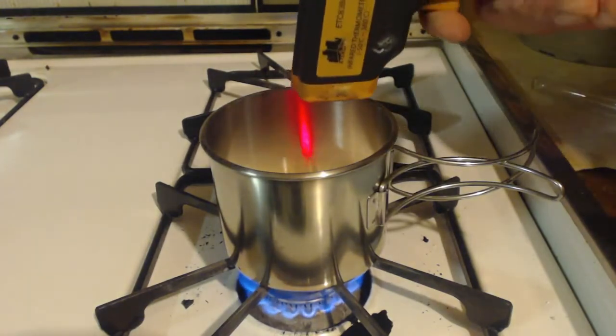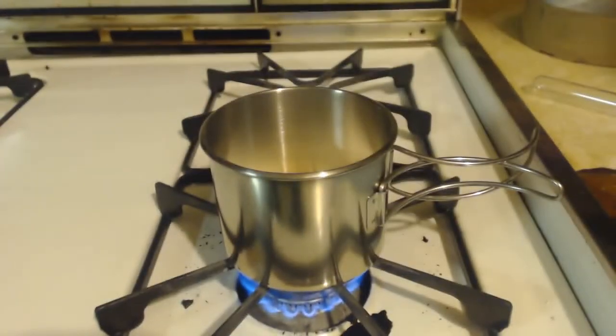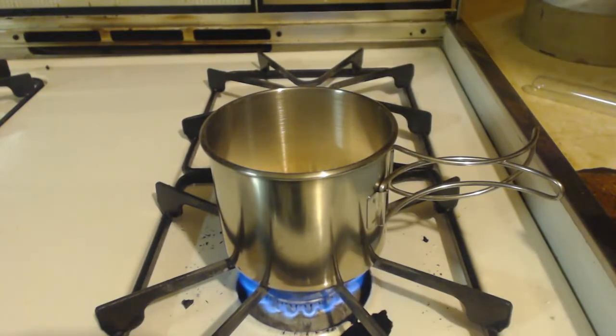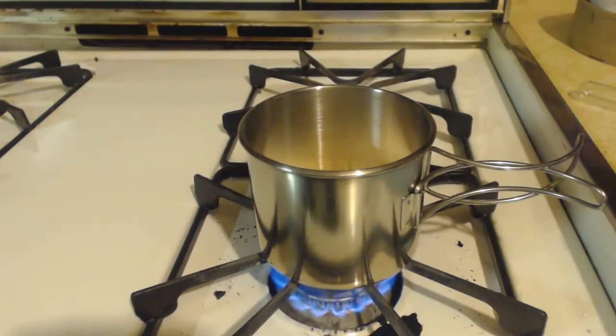It's up to 55 C, so I've got a long way to go. But anyways, that would make it hot enough, because that's a lot of heat, 2,400 whatever Celsius. Heat the calcium oxide up, and it would make this bright, super light. And then I guess they used tin or mirrors or whatever to reflect the light onto the stage. So nothing's really happening here. Let me try to stir it up.